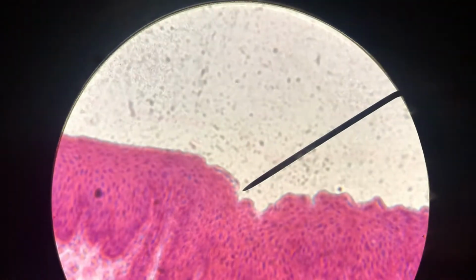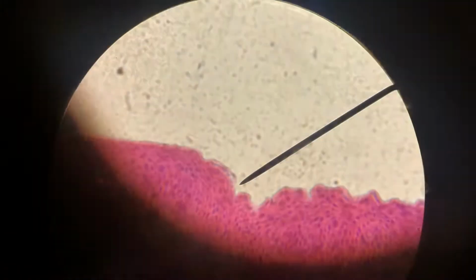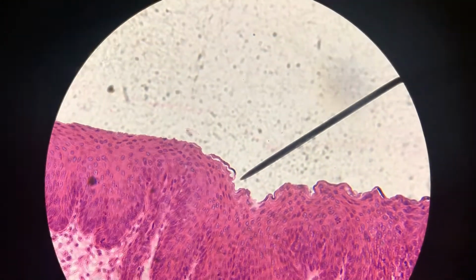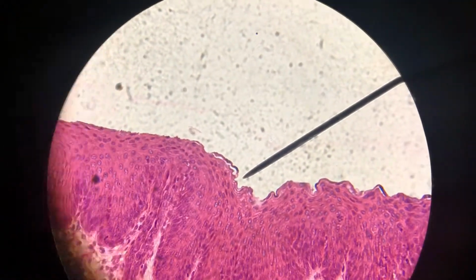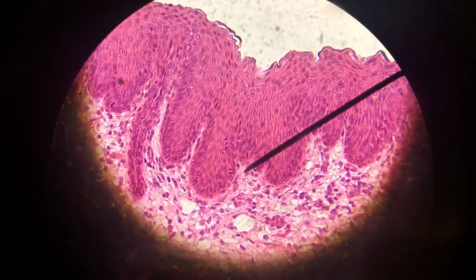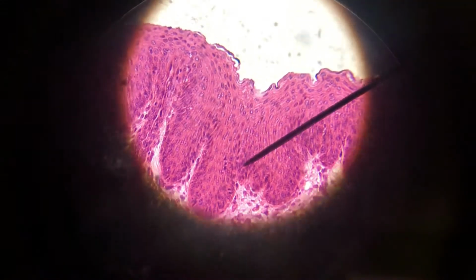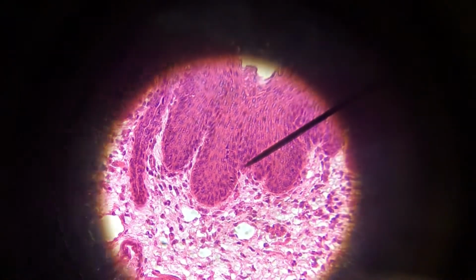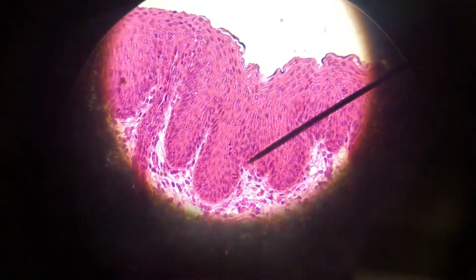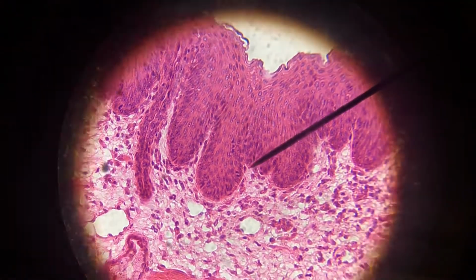That's the apical surface that's free and would be exposed to food and abrasion. So we can readily slough off those cells as food scrapes by. And then as we move here, there's the basal surface right there. And underneath there is the areolar connective tissue, that's the lamina propria. But we can tell this is the basal surface because it's attached to our basement membrane.